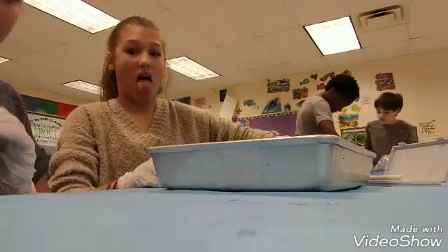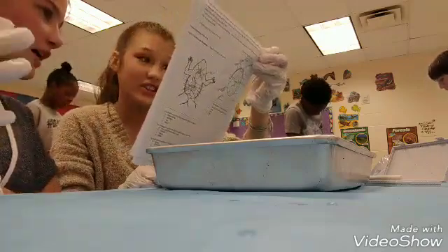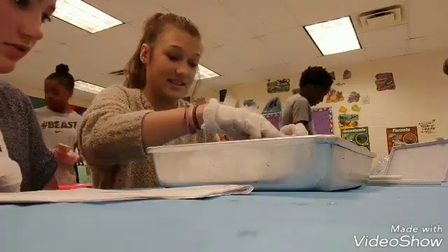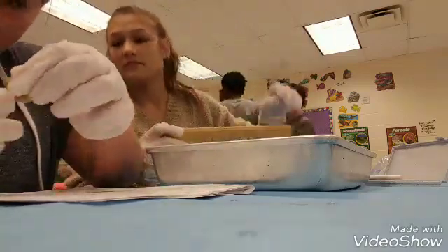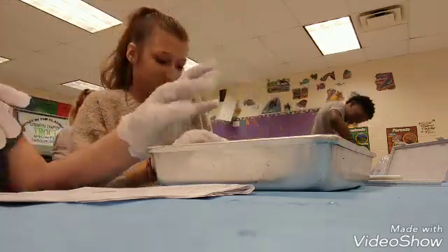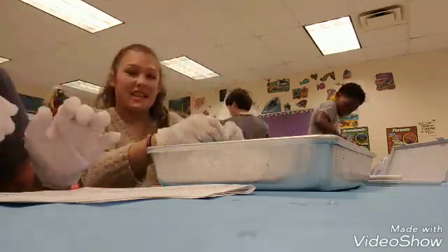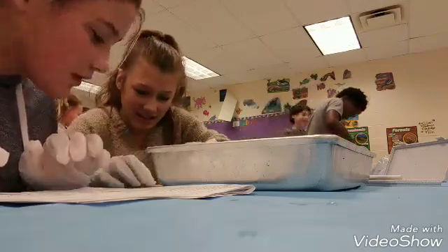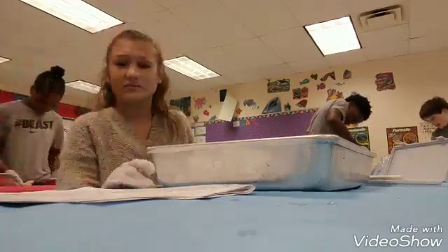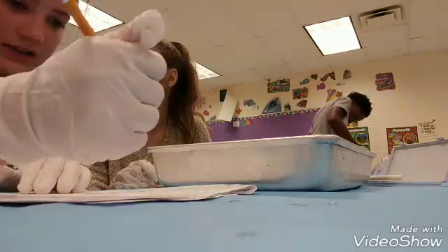Okay, that should be good. Let's check that. What is the purpose? Stretch the small intestine out and measure it. What's the small intestine? Yellow. Where's the ruler? Okay, we're gonna borrow y'all's ruler. Okay, we're gonna measure that. Okay, it's an inch and a half. That was really a guess. Where did my pencil go? Oh my god. Okay, small intestine.